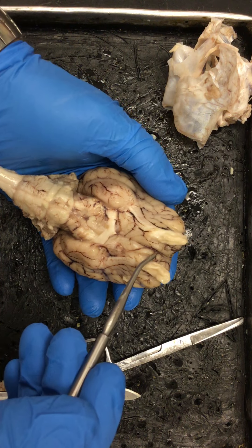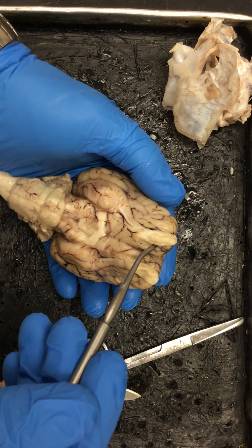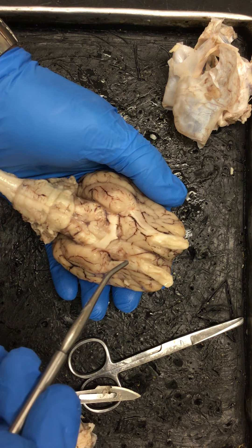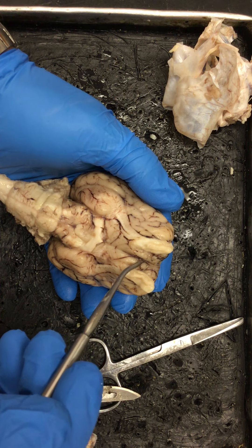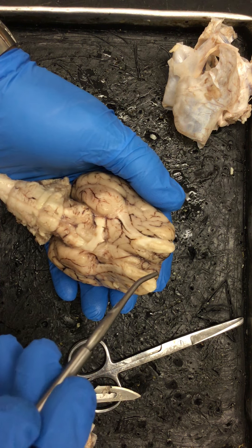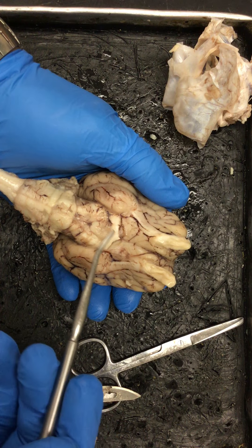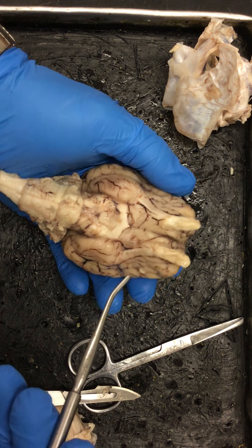The first structures we're going to look at are the olfactory bulbs. There's a little bulb here and a little bulb here. Those olfactory bulbs — your olfactory sense is your sense of smell. This sheep has enlarged olfactory bulbs compared to humans. I'll leave you to determine why you think a sheep might need a larger olfactory bulb as you answer that question.